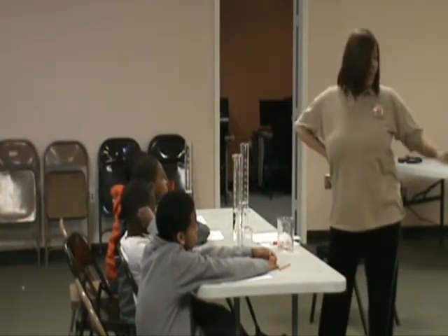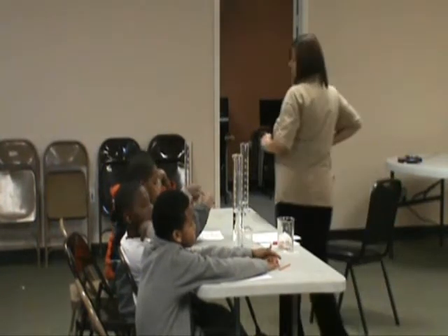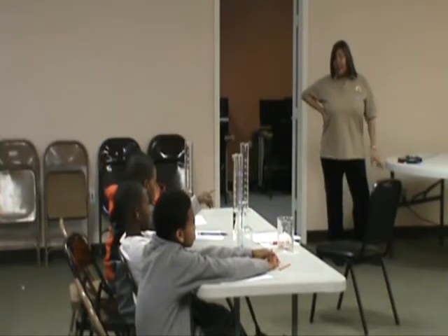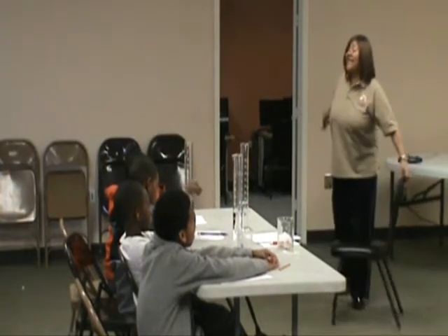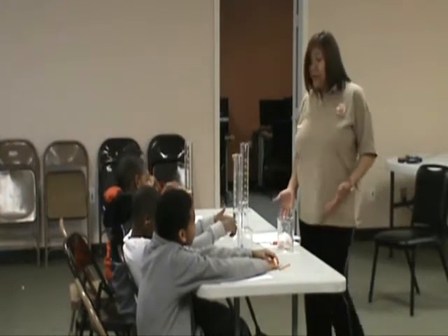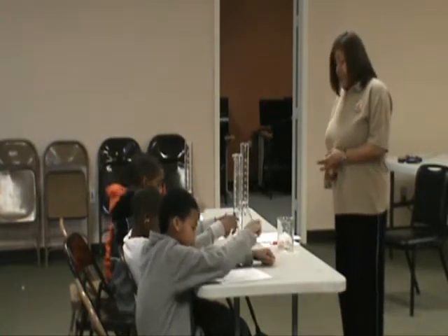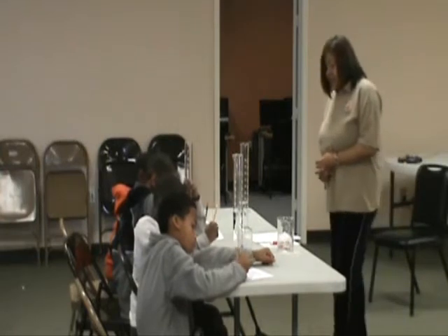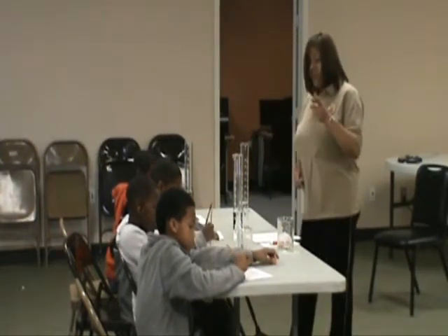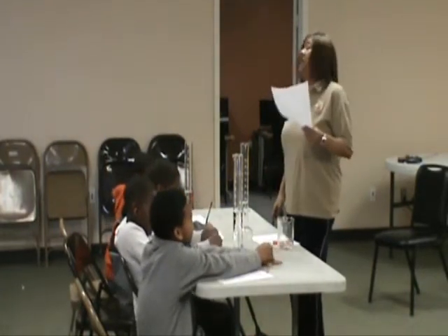I am going to have you come around me for just a second, and we're going to use a manual balance. And then, because we're fancy, we're going to come over here, and each of you will learn to use the digital balance. The digital balance is an electronic balance. It will give you the mass of your unknown metal. Look in the materials list and put a check by unknown metal and by balance. These are the things we're going to work with. And we've already used the pipette, so put a check by it. Have we used water? Yes.